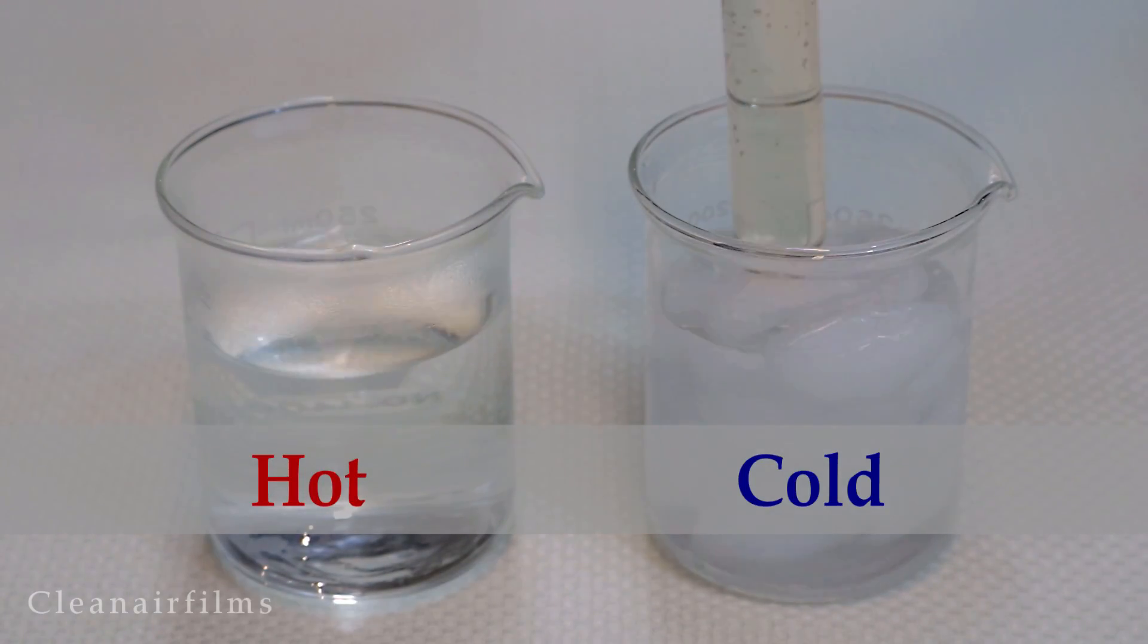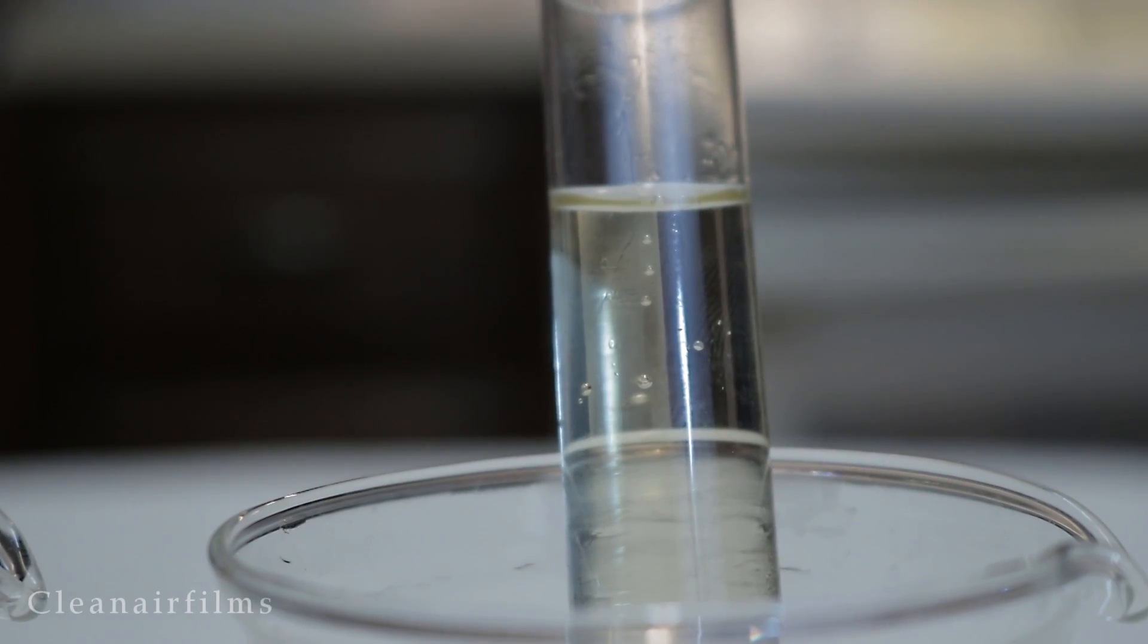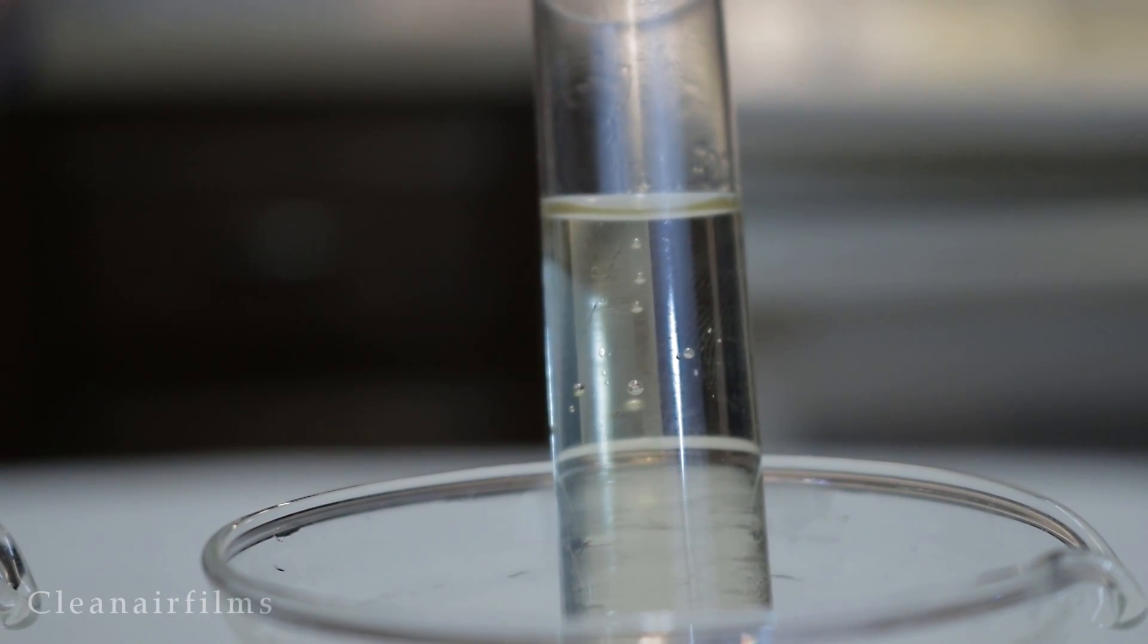Now place the test tube in the cold water. Notice how the bubbles slowed down. This is because gases are more soluble at a cold temperature.